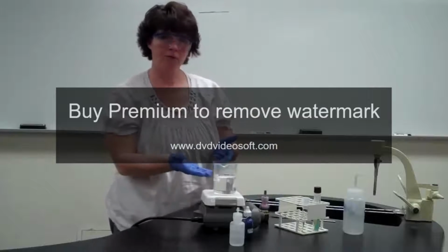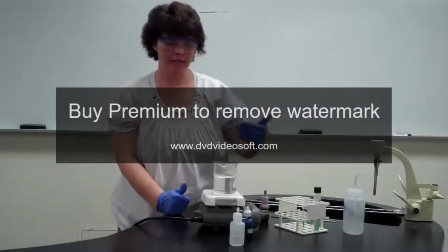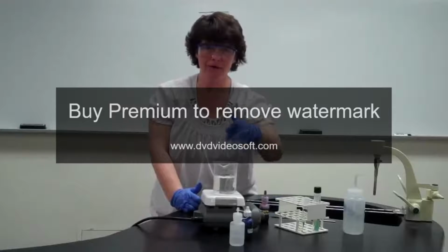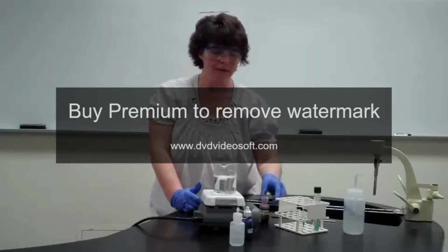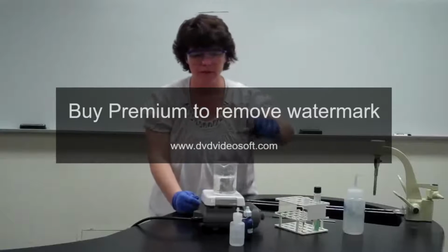Our goal is not to make the water change color. Our goal is for the stain to penetrate the slide itself. So you put the slide up here after you fix the smear, but before you put the stain on. Now you're going to add the stain, and you're just going to flood it like you've done with previous labs.